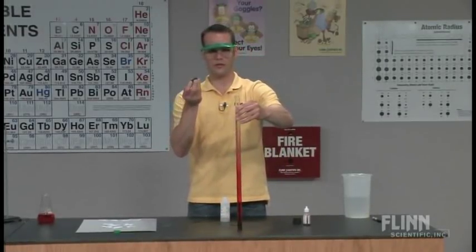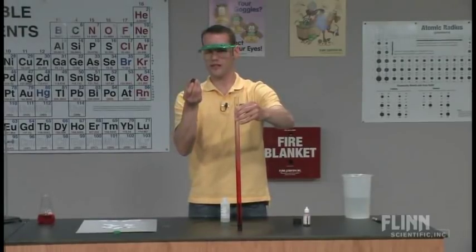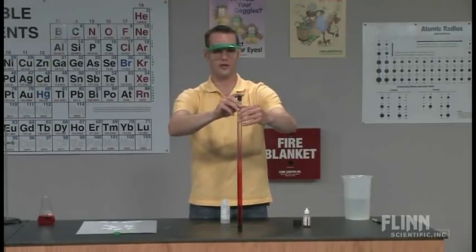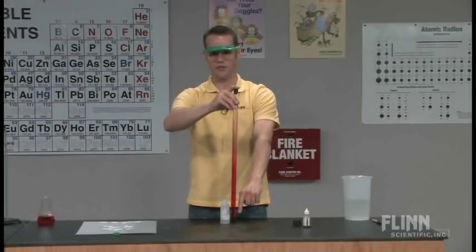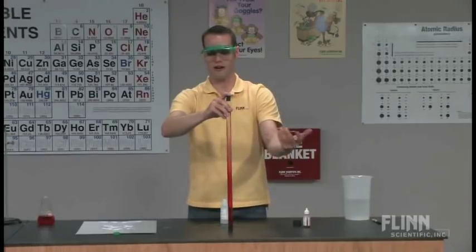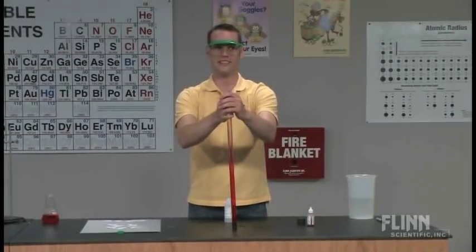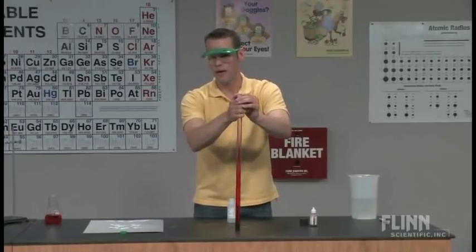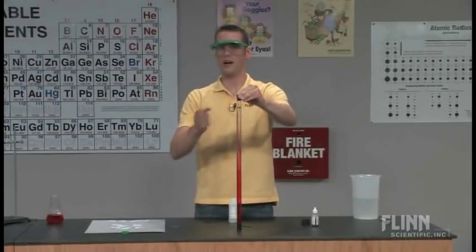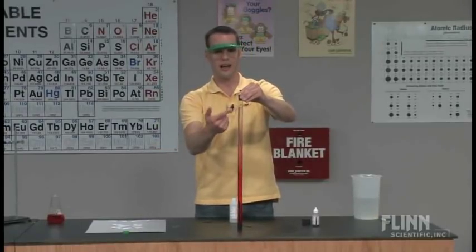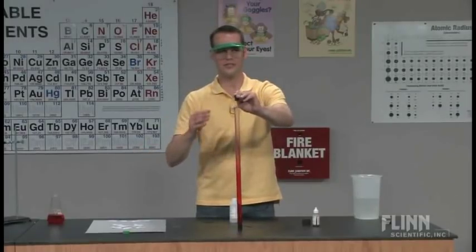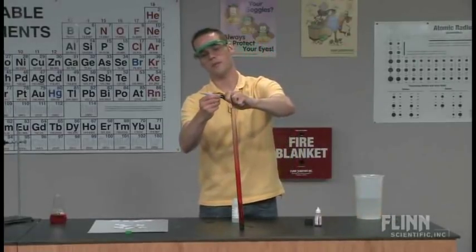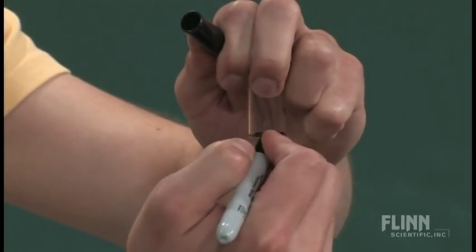And then I cap it at this point. One important thing, if you do get a rubber stopper that fits your glass tube that you use for this, poke a hole into your rubber stopper. If you know anything about Boyle's Law, when you push down on this to cap it, you've just built up a lot of pressure. So when you push down here and you lift the tube up, very often you just push the stopper off the bottom of your tube. So a small hole at the very top, just make it small enough a very thin pin hole will be fine. Enough that air can escape. And stopper it well. And at this point, I'll walk around or I'll pick one of the students to come up and mark a line on this. I want to make sure that they don't think there's any trick up my sleeve. So I'll usually have a student come up and mark the line on the tube where the liquid level is when we begin.